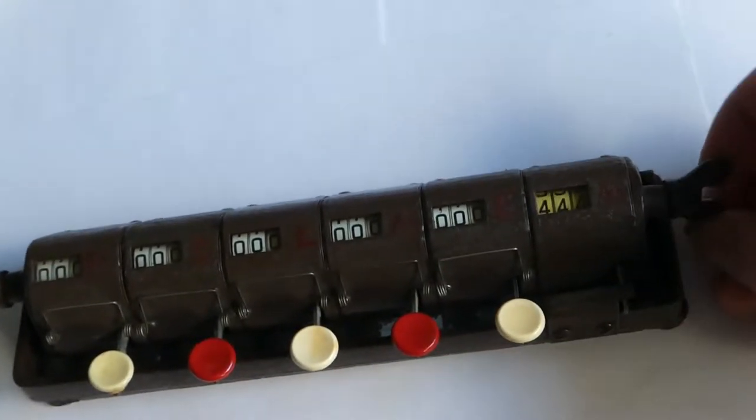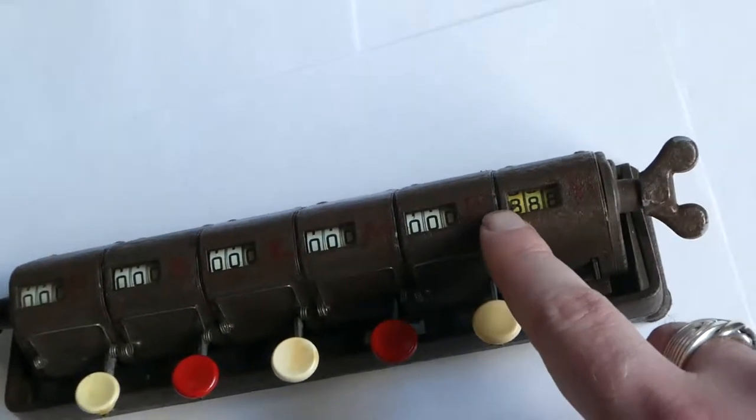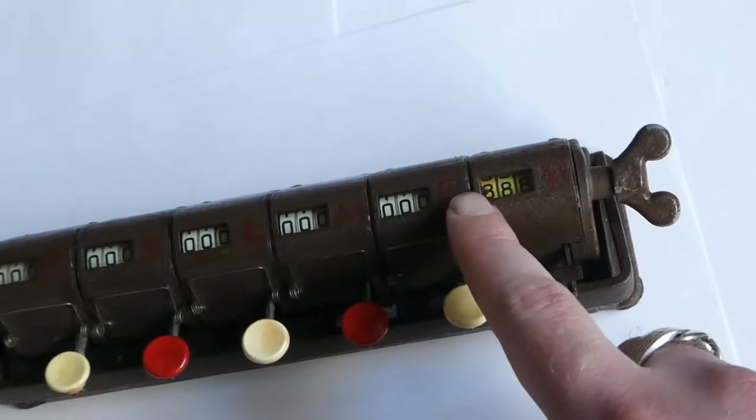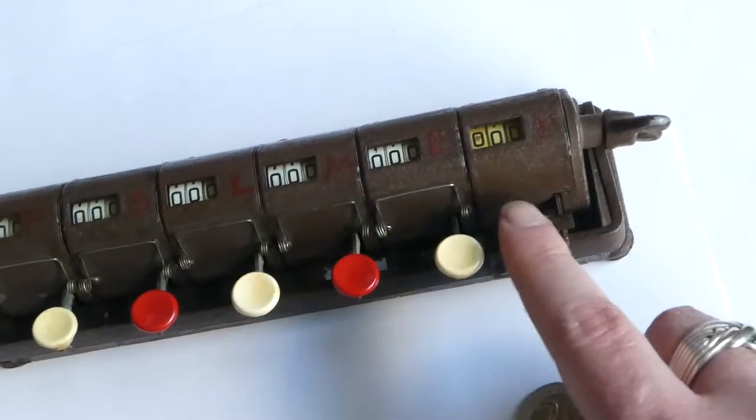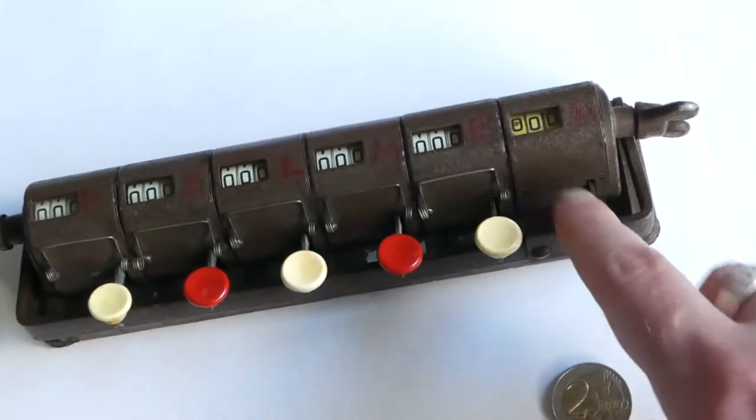You can actually see if you turn this up to eight, there would normally be a small pin in the eight there which is missing, and that would trip this lock as soon as it's switched to 100.